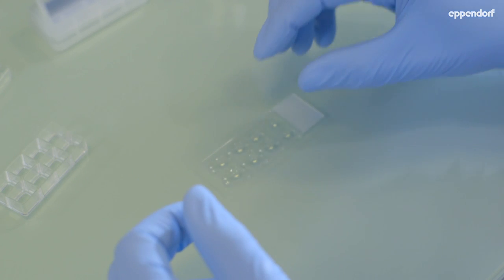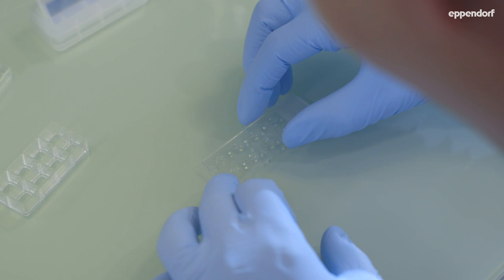Make sure that the coverslip is placed precisely on the slide so that the cells are not beyond the working distance of your microscope objective.